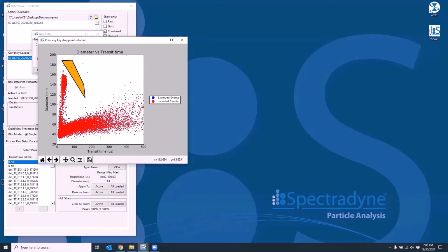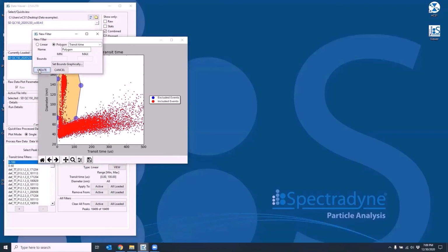Remember, the filter is inclusive, so anything inside the polygon will be included, anything outside the polygon will be excluded from the data. Once you create a desired shape, hit the Enter key on the keyboard. You can still modify and adjust the shape of the polygon afterwards if you like. Once you're happy with the polygon, hit Create and then apply the polygon filter to your data.